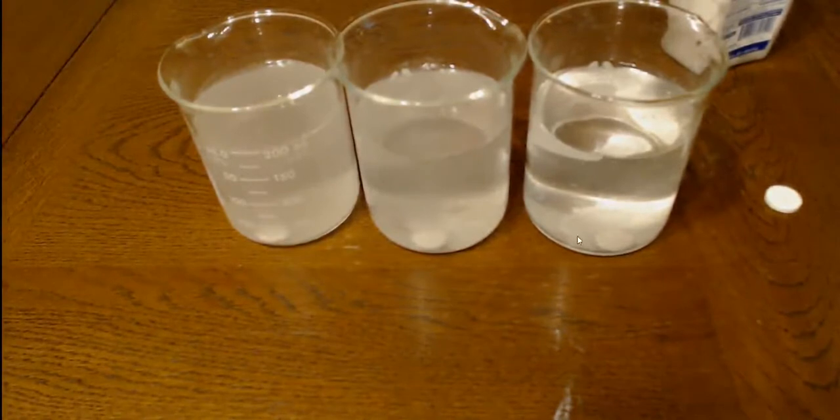See how big this one is? See how little that one is? This one's close, but it's a little bit bigger. So we can see the size as well. This one's getting eaten up much faster than these. This is close to its original size still, so that's another observation we can make.